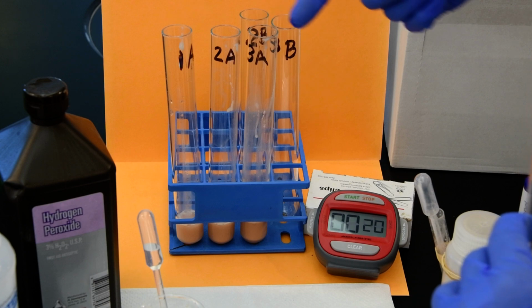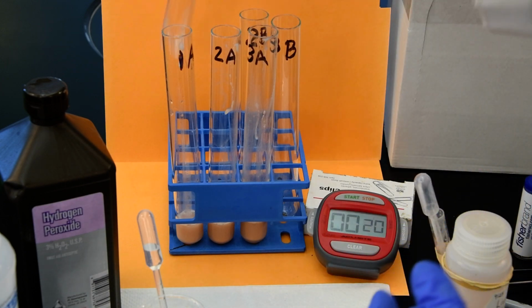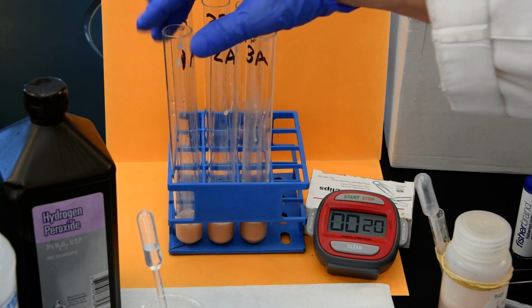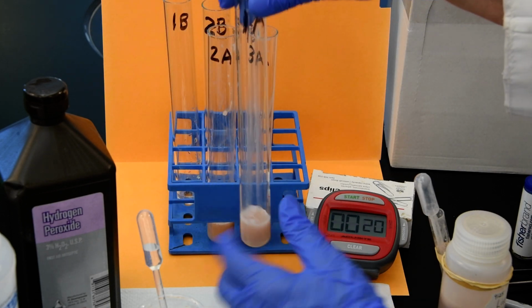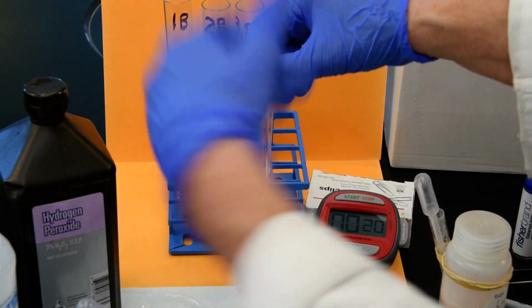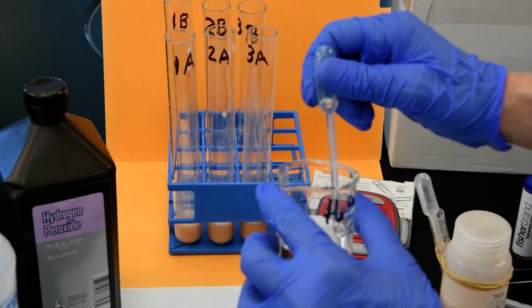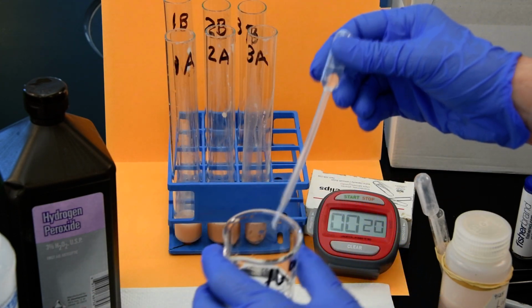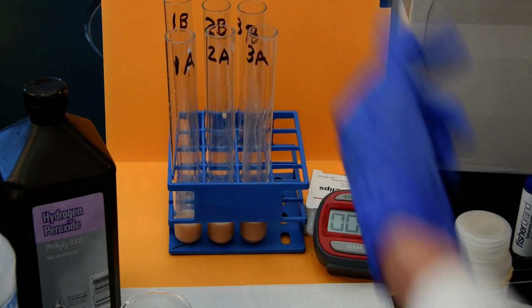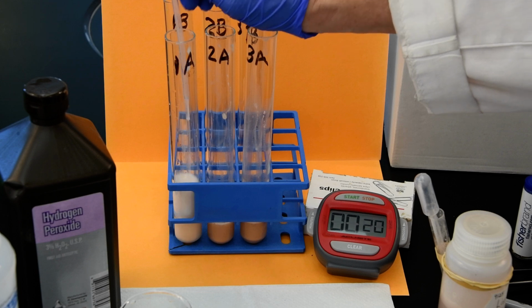Because again, we've already made the variation here, and we're going to do each one at a time, where in lab, we always have the students do it simultaneously. So we're just going to add the 1 transfer pipette to each one by one and measure. We'll do 1A here. The other thing that this will accomplish is I won't have any transfer error. I won't leave any hydrogen peroxide behind. I'm just putting it directly in and getting out of the way.